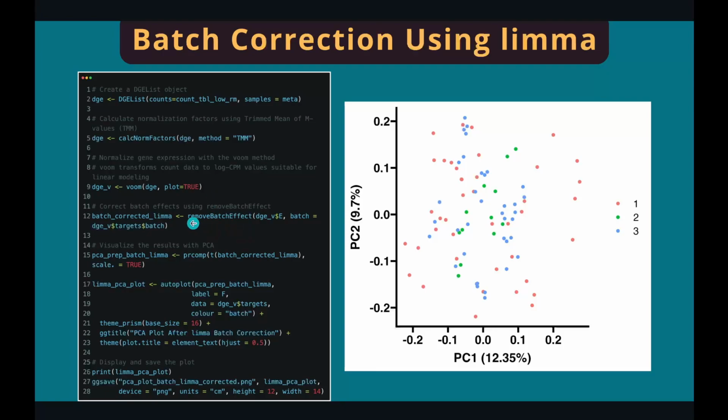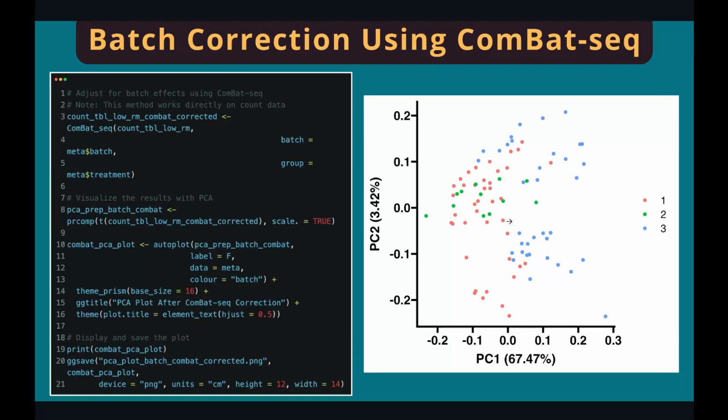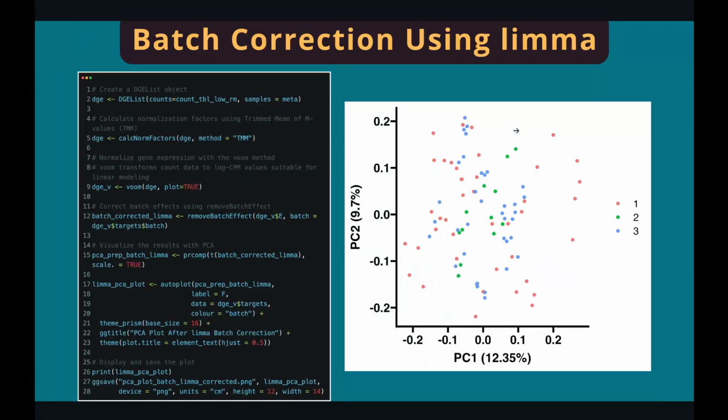With the corrected gene expression values, we can make another PCA plot in the same way. And as you can see, the results are much better than the one we used before, the ComBat-seq. In this PCA plot, all the samples are very well mixed, much better than before.